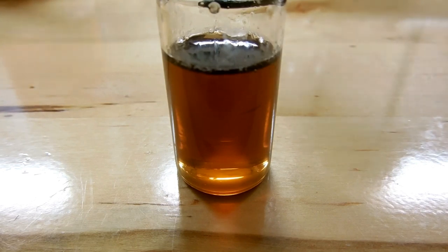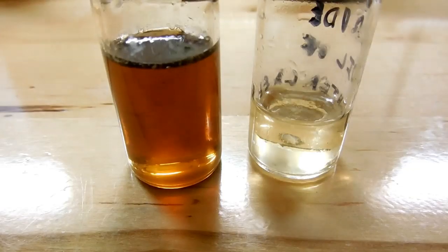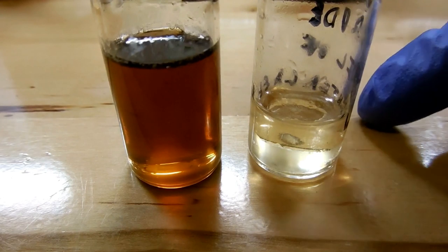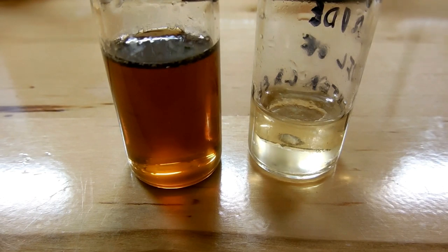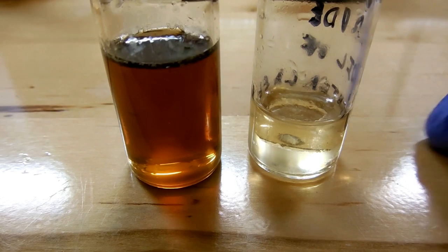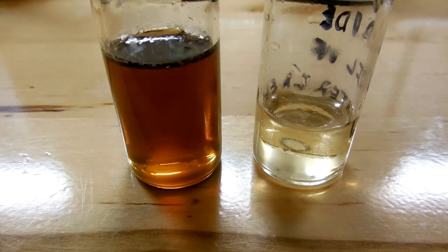You can see the color of this is very brown. Compare that to some oil that I did in another run and it's quite a difference. So this oil seems a lot nicer than the brown oil that I just made. That's possibly because I ran this reaction for four hours instead of the one hour recommended. I think this one was actually a compromise between the two at something like two hours. So maybe running the reaction too long produces extra byproducts that discolor it. But it still smells fantastic.